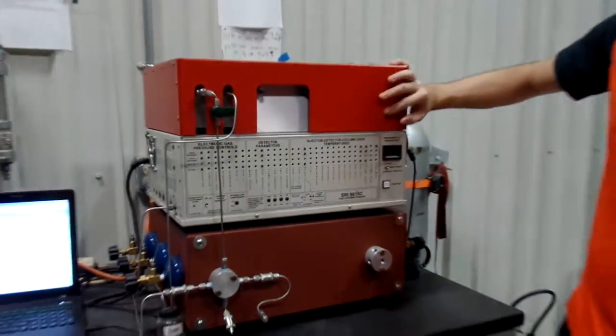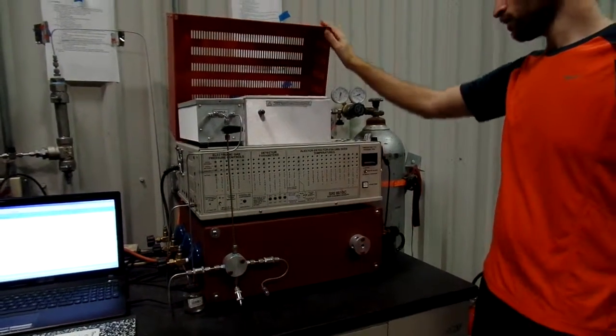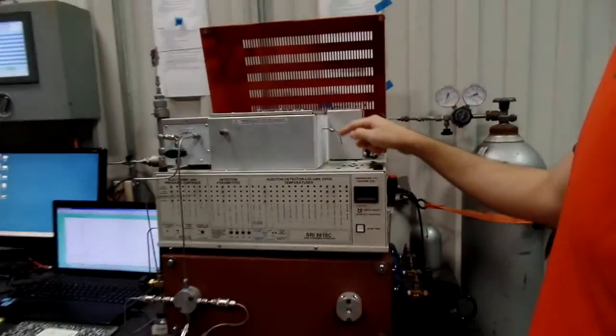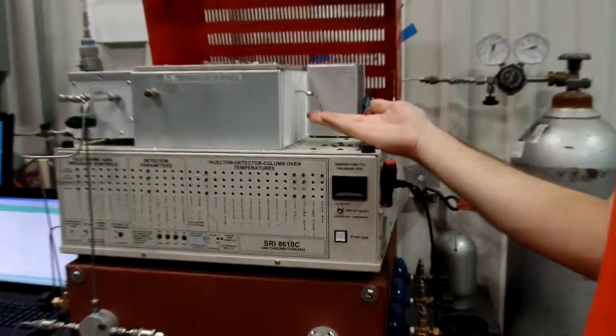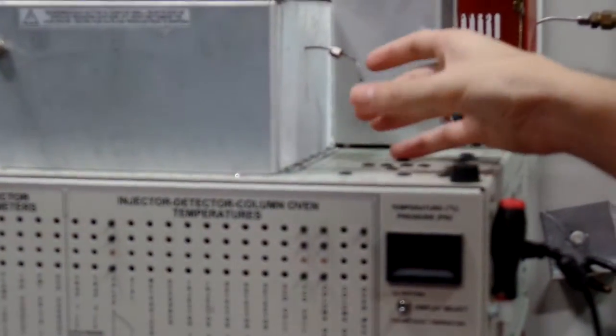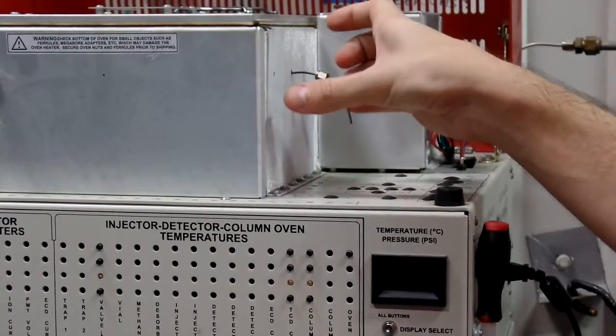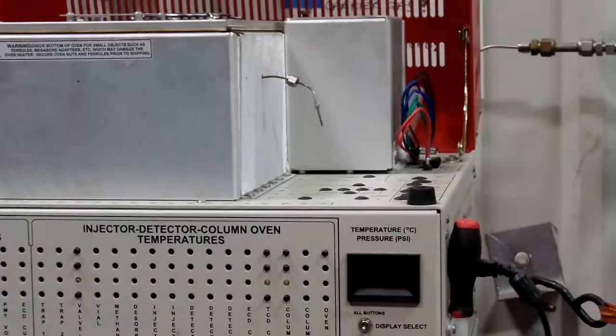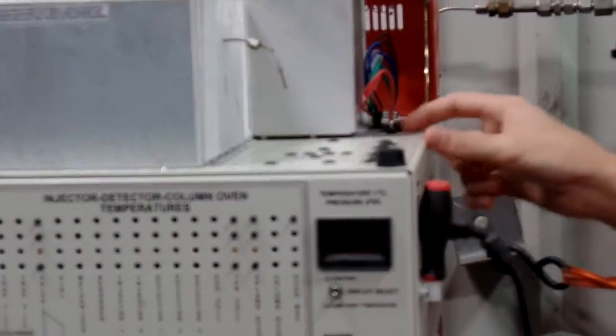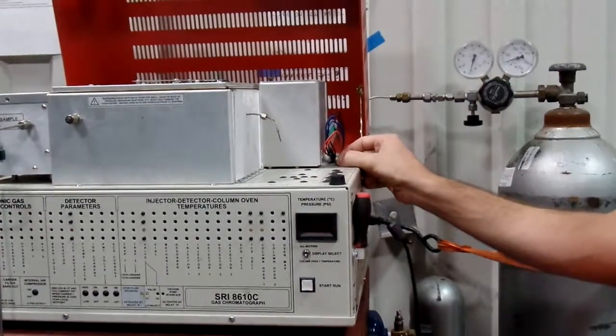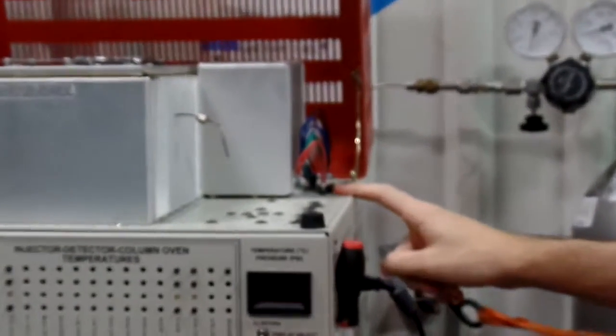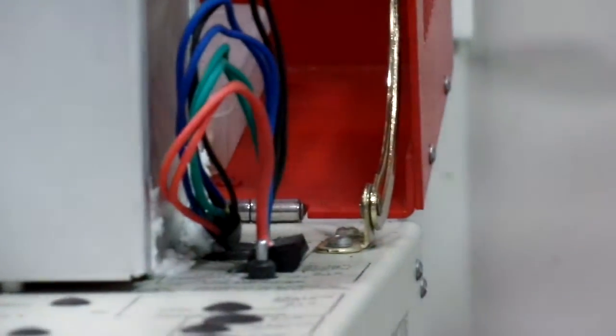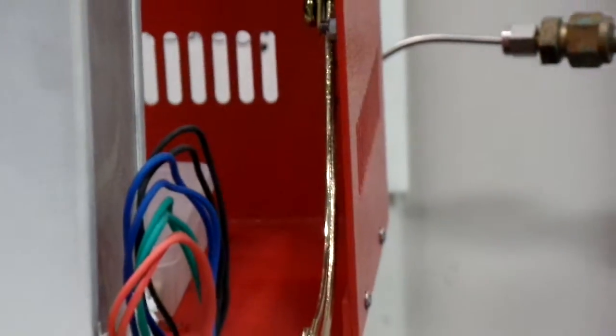For the GC, it's on. You'll have argon coming out of here, this little guy. You can't really tell if you put your hand there. It's too light of a flow. You just got to get a little glass of water and put it through there and let it bubble and you'll see the bubbles. So this is not the master on switch. The master on switch is back here, right here. So it's off right now.